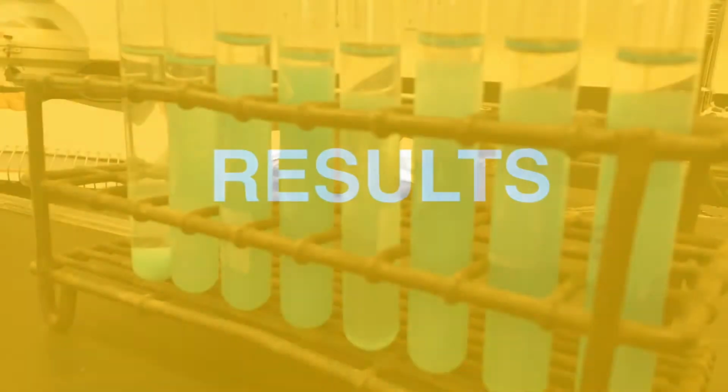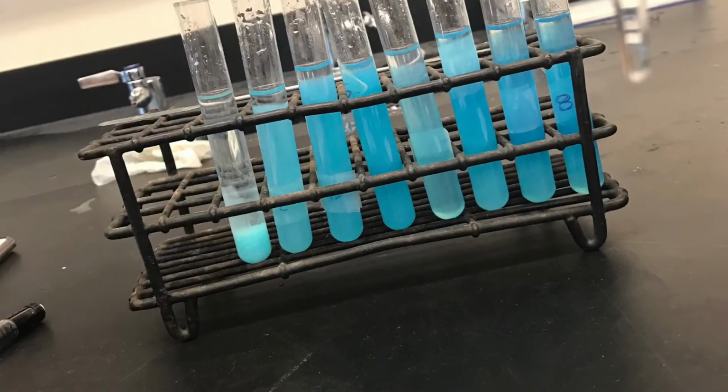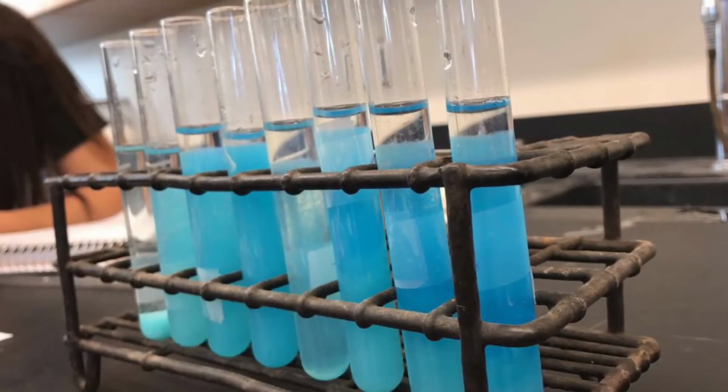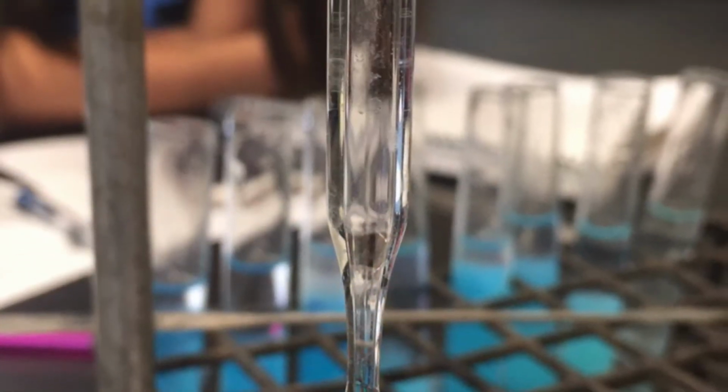While performing the lab, we saw a vibrant blue crystal-like structure at the bottom of the first 4 test tubes. The 5th test tube appeared to be a well-mixed light blue solution. Test tubes 6 through 8 were also blue solutions, but they had excess clear liquid sitting at the top.